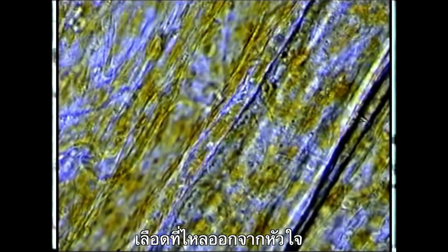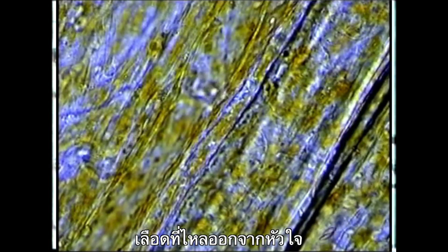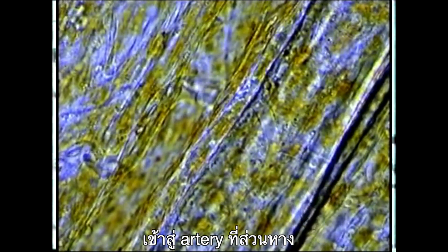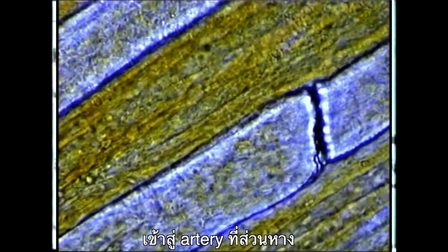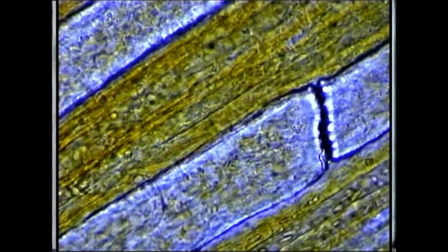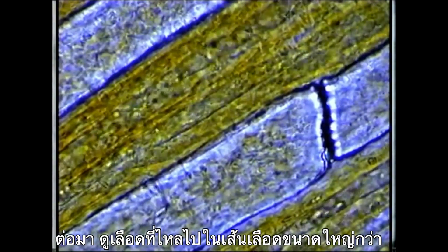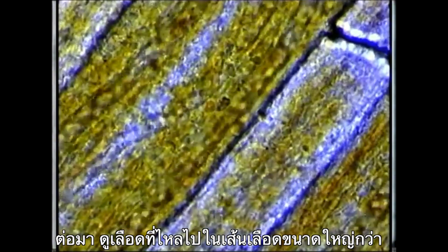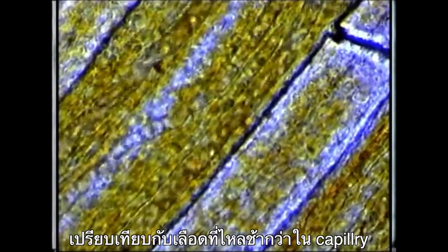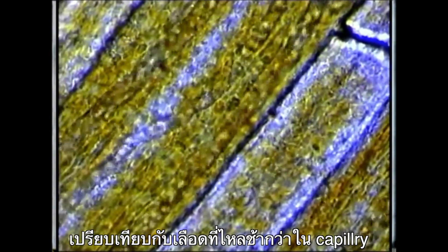Here we see blood flowing away from the heart through a large artery in the tail. The flow rate is high. Here we see blood flowing in a larger blood vessel. Compare this to the slower flow in the capillary.